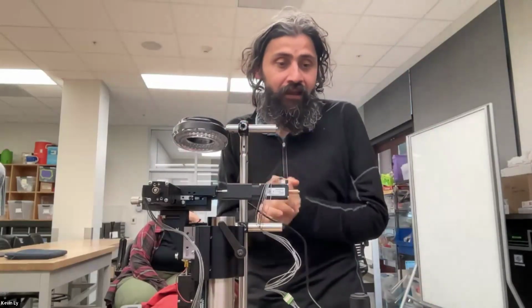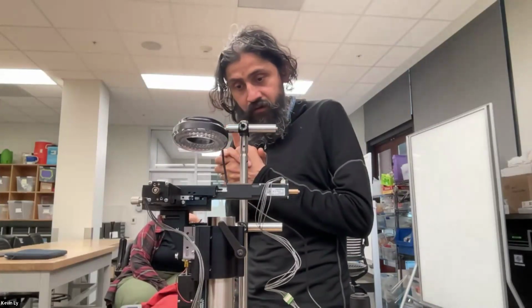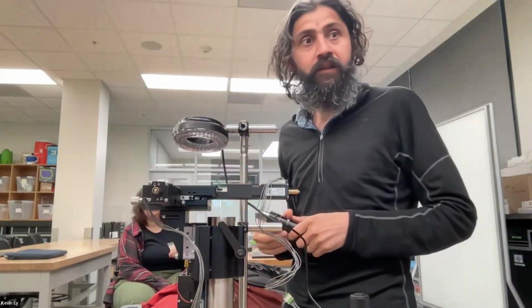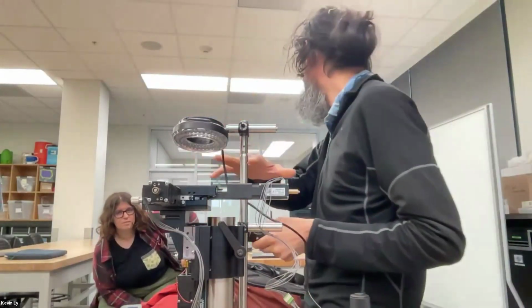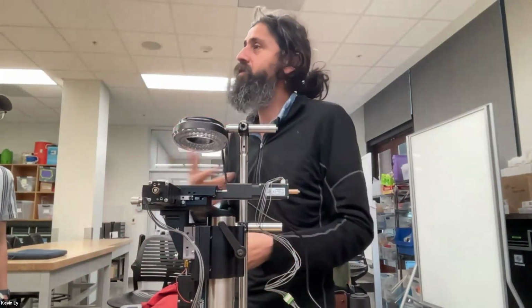Okay, on that note, I have to run. There is a camera cord. You could just swap this with this itself. There is a cord right in there. And I think when I had Enrico tested this, and this is up and running basically. And play with it. If you can't get it up and running, I'll kind of do that on Monday.